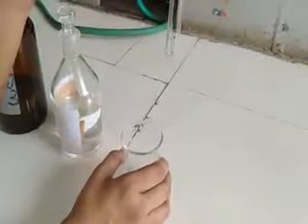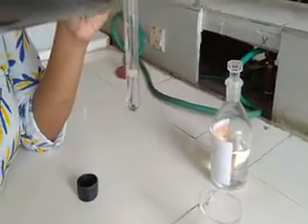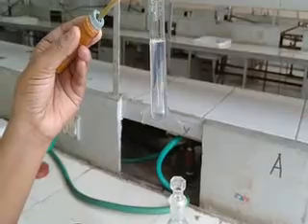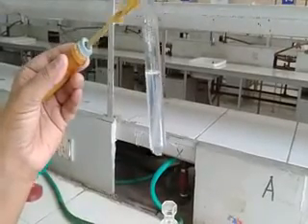Now we will do the test for halogen. For that, I will take 1 ml of Lassaigne filtrate, add dilute HNO3 (nitric acid), then boil and cool the mixture. After boiling and cooling, we will add silver nitrate solution. As you can see, the given mixture does not form any white precipitate or any precipitate of any color, which confirms that the given organic sample does not contain any halogen.